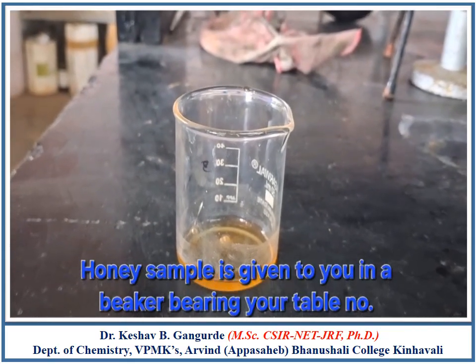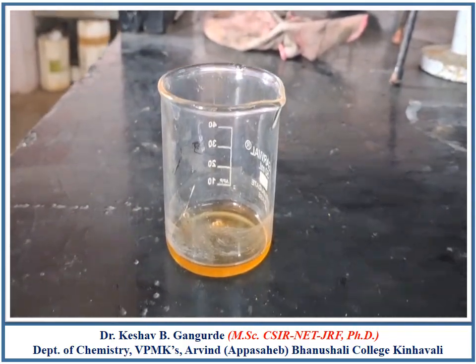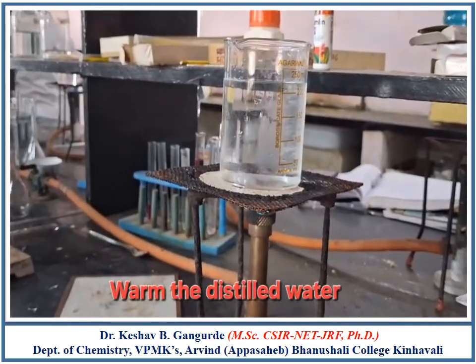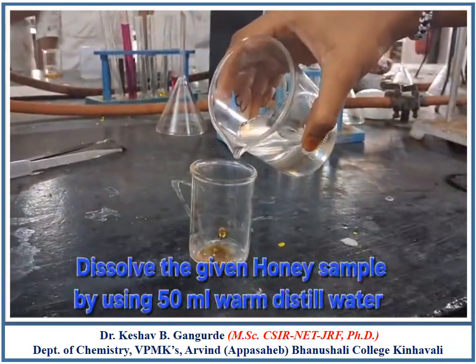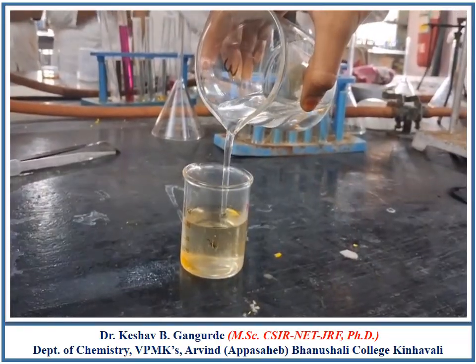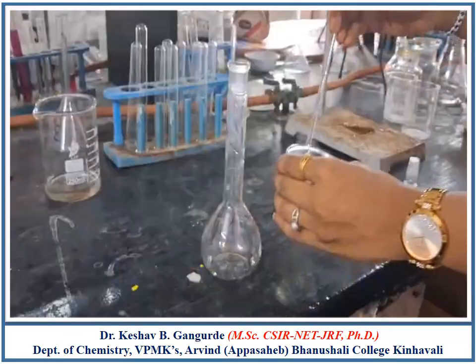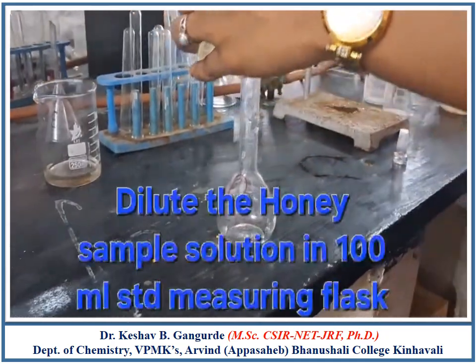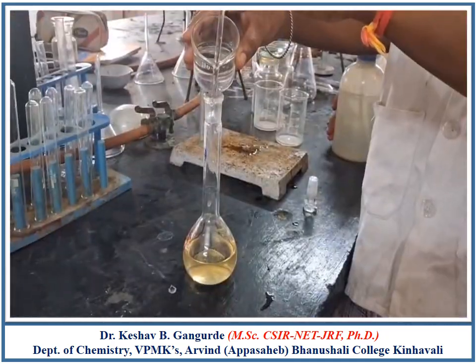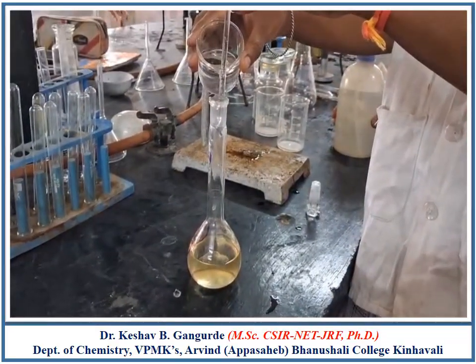You are provided with a honey sample solution in a beaker bearing your table number. Warm the distilled water in a beaker. Dissolve the honey in warm water. Transfer the solution in 100 ml standard measuring flask and dilute up to the mark by using distilled water.